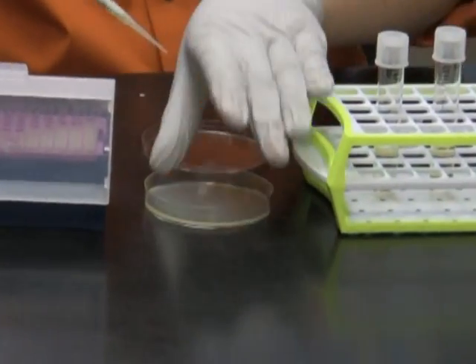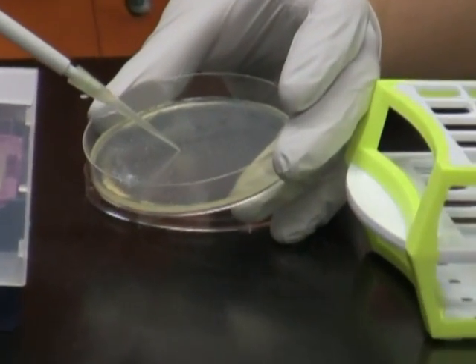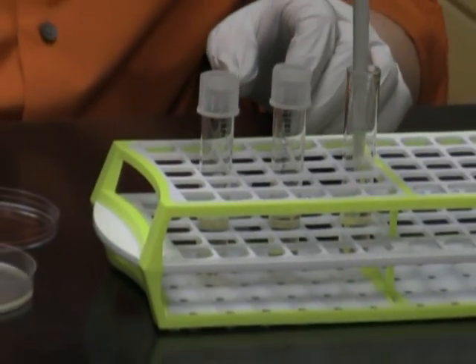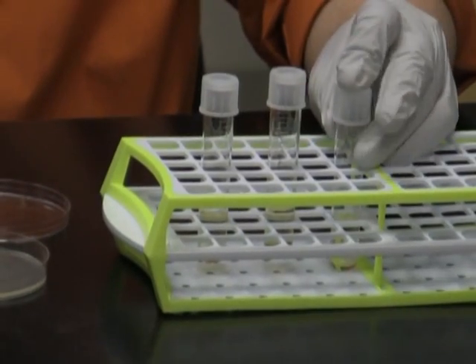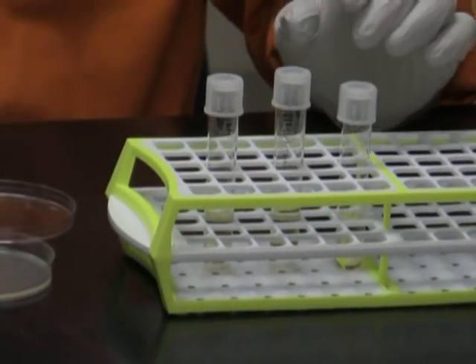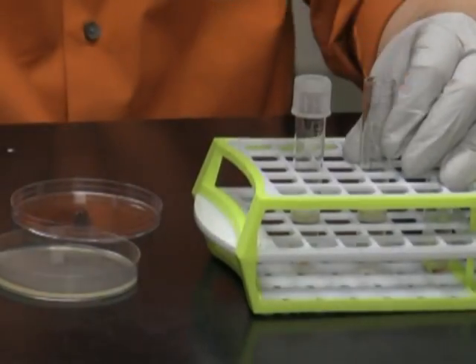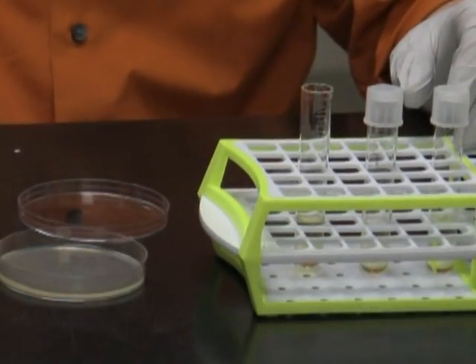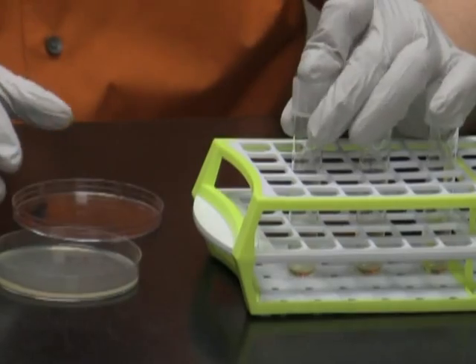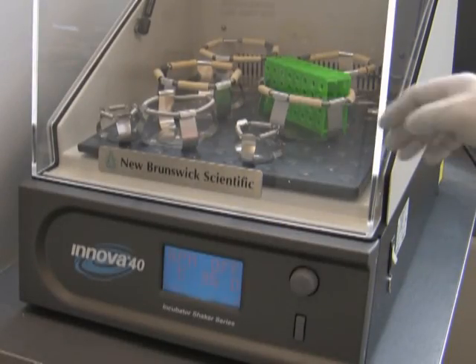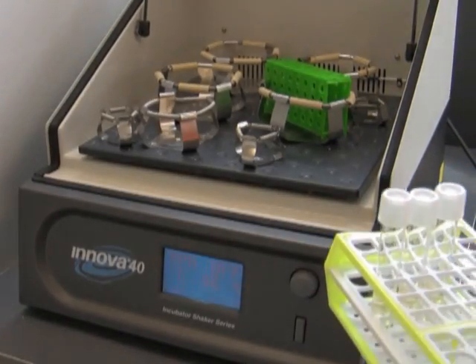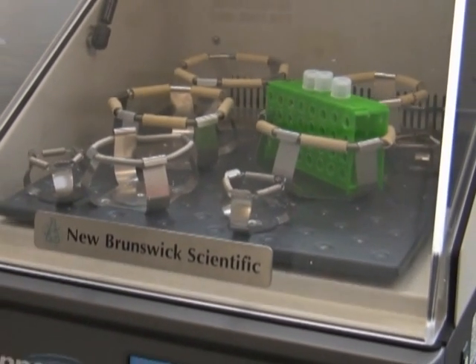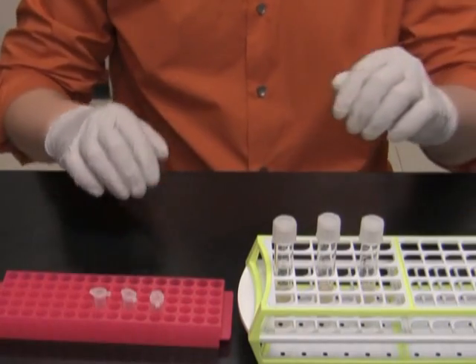I repeat the same procedure for the other two tubes. The culture tubes are incubated overnight in the 37 degree shaker. We are now on day 3 of our cloning protocol.